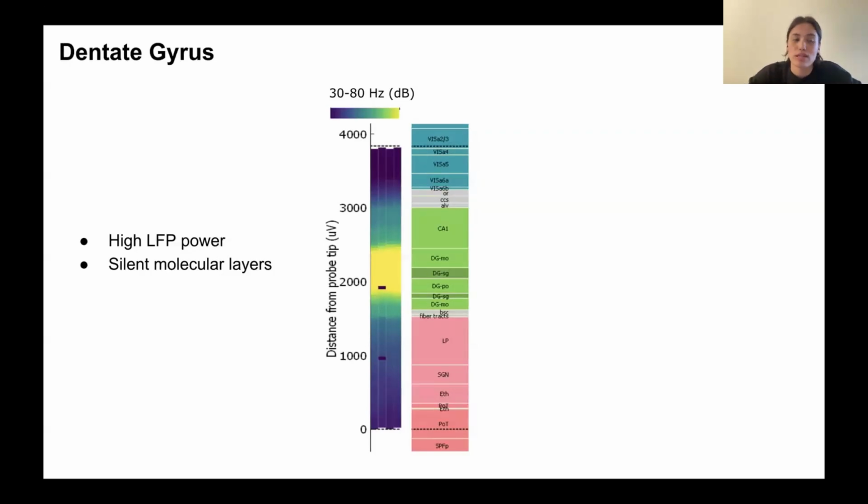So another one that actually wasn't in this table, but the dentate gyrus is a very useful feature. So this is in the hippocampus and has two very distinctive features. So the one is that it's got this very high power in the LFP band. So here we're showing the LFP's power spectral density overlaid on the geometry of the probe. And we can see that here in the dentate gyrus, we have this very, very bright yellow area, which shows that it's got very high power.